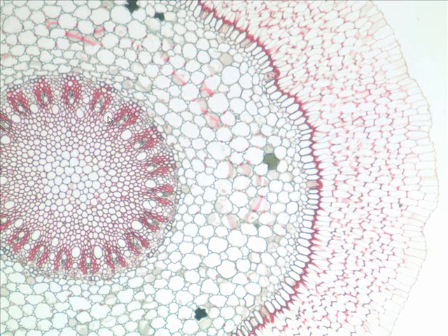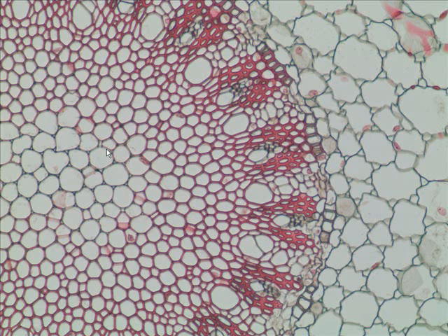And so these big cells are big pipes. What kind of tissue are the big guys? They are what? Xylem. And in between xylem, we can see patches of what? Little greenish patches of what? Phloem. Let's take a closer look.